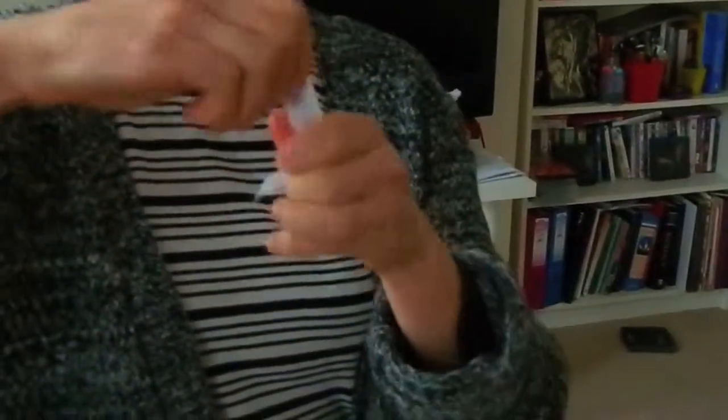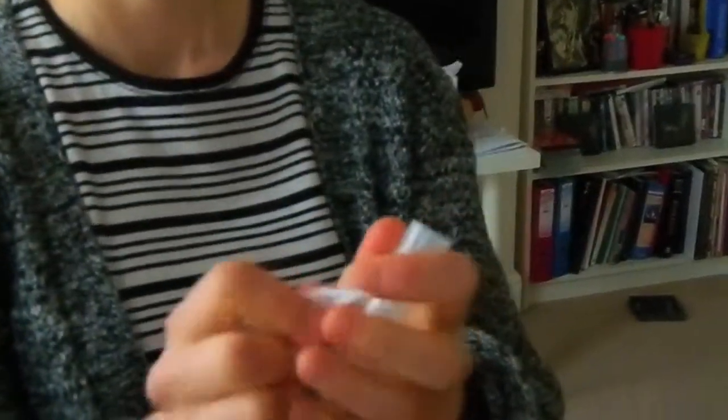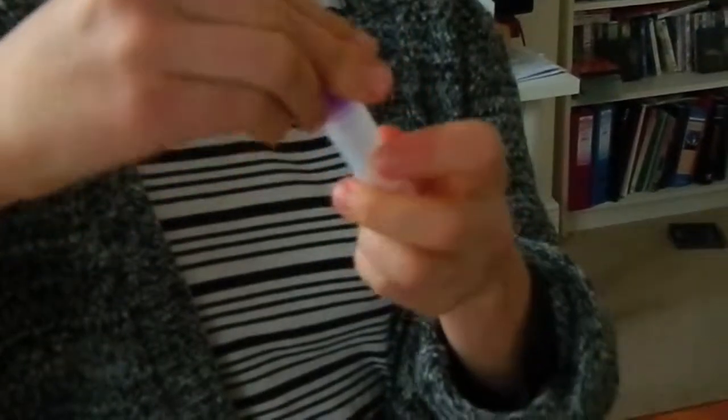You've got your little kit here with your test tube. Detach and unscrew the top part, then place the rope inside that part. Pop it back with all your little bits and bobs, and place it in the freezer, right in the middle.